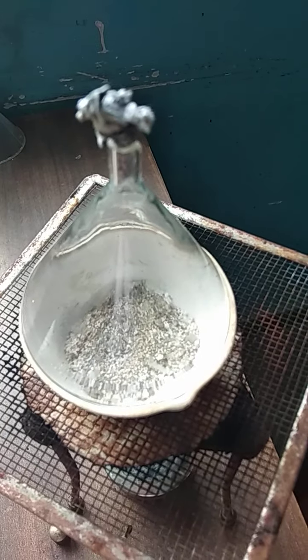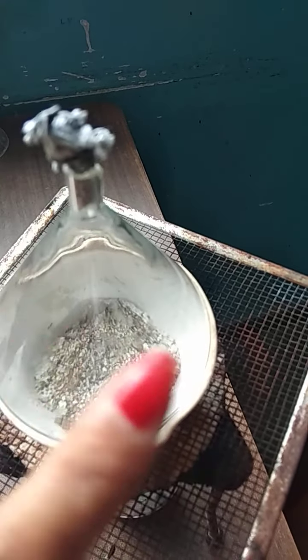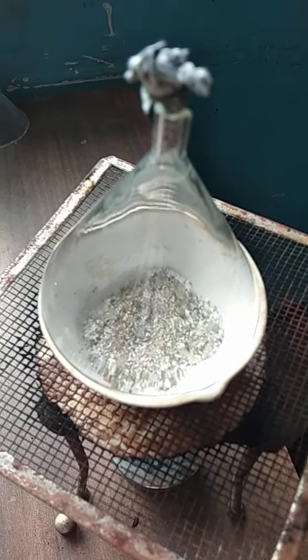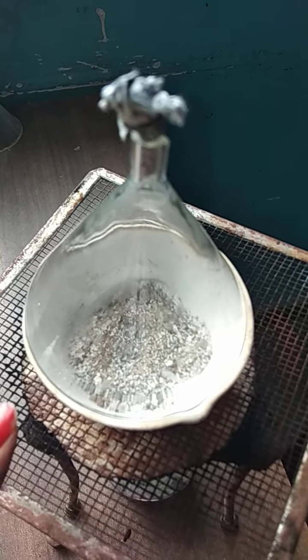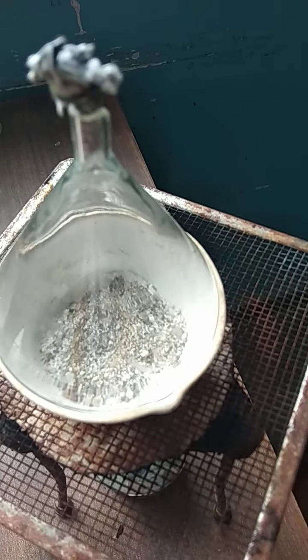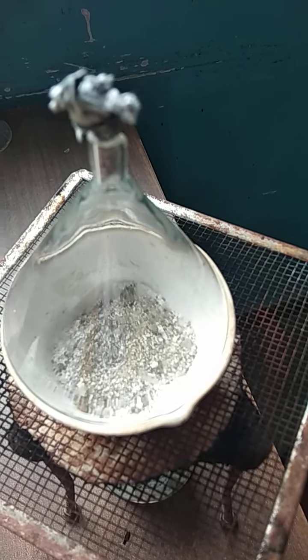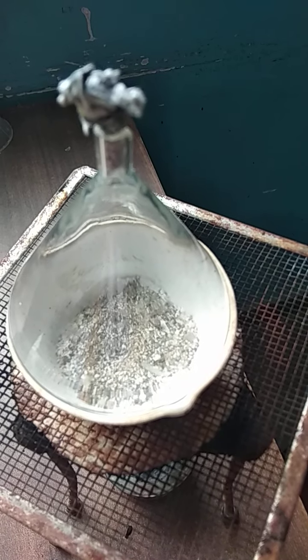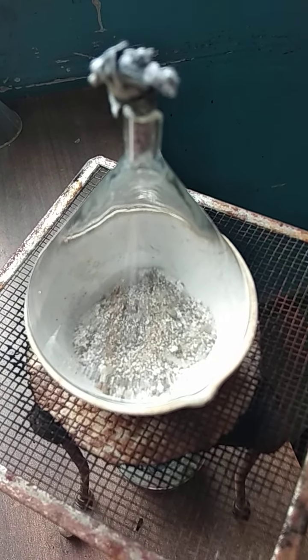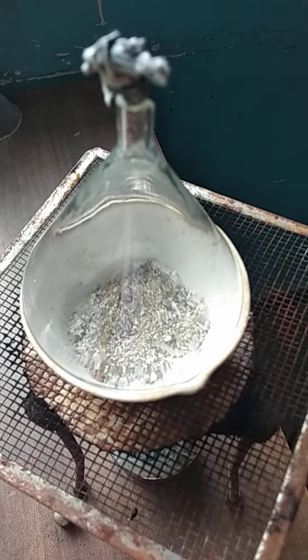So ammonium chloride particles will come and form precipitates at the top, in the form of white particles, which we could see after some time, and the left-over particles will be of sand in the china dish. This shows that mixtures in which one material shows the property of sublimation and the other does not can be separated by the process of sublimation.